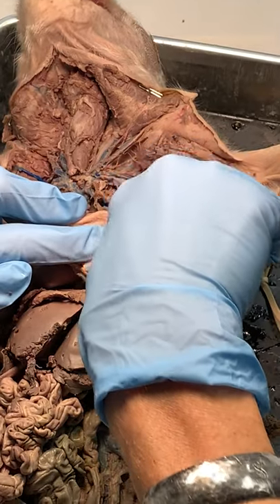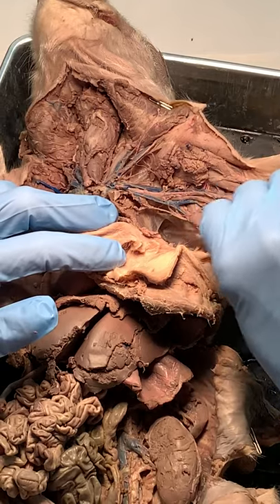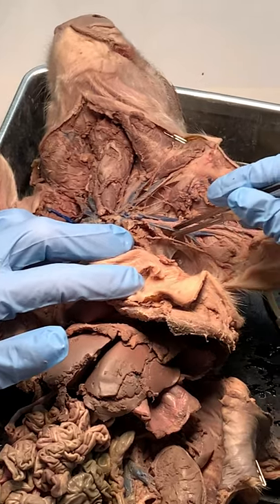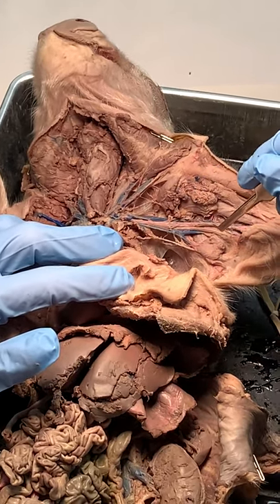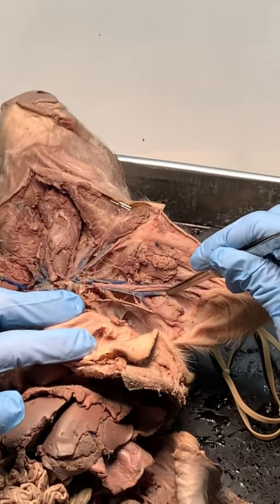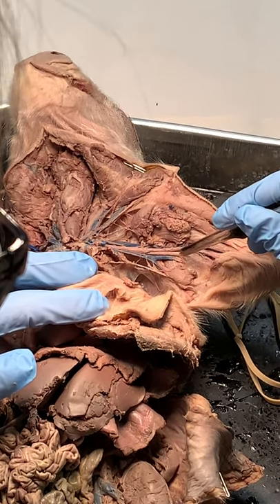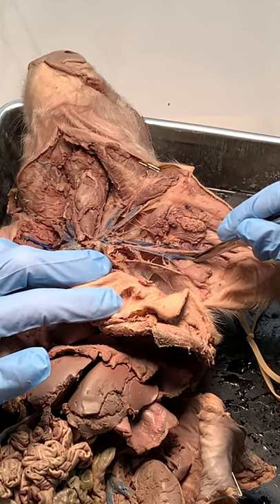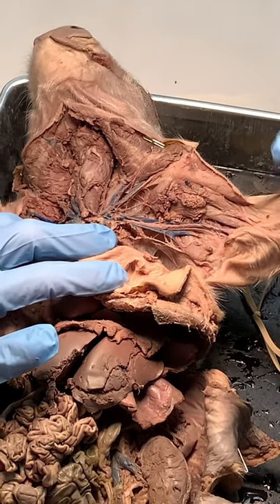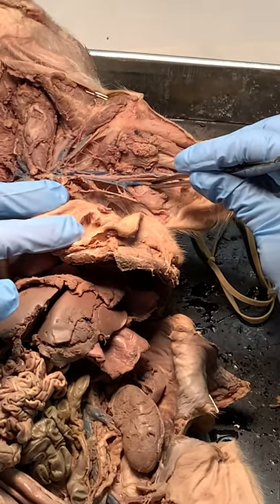Then I'm going to go out to the axillary area — the armpit area. I've gone outside the ribs, popped through, and I'm in the armpit area. Anything hanging out over that empty area is axillary. Now going onto the muscle of the arm itself, anything on the arm I want you to call brachial. I'm above the elbow — that's where you'd put a blood pressure cuff.